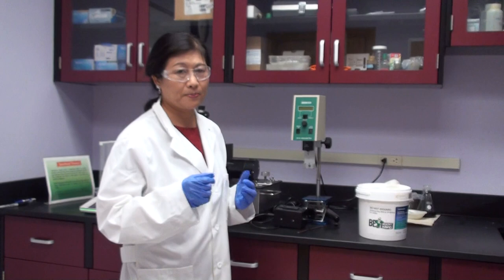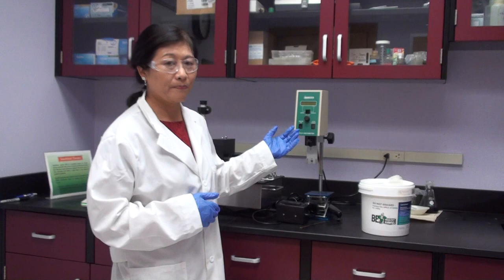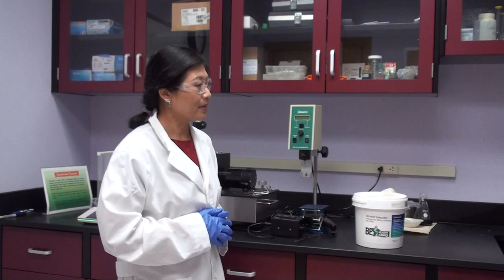But just remember, in this viscosity meter, we cannot test the heavy oil viscosity. If you got some heavy oil from Canada about 600 mPa or cP centipoise, this equipment is not available. You need to have a higher viscometer to do that.